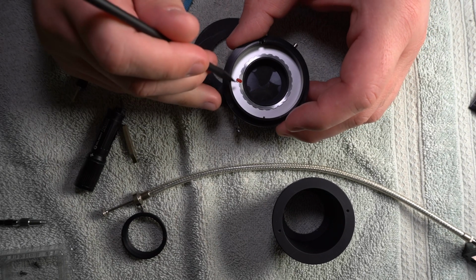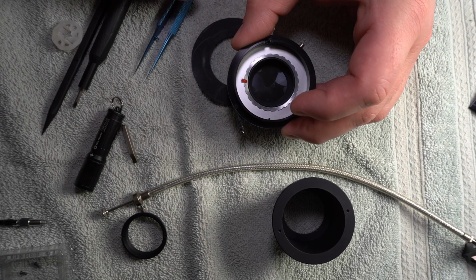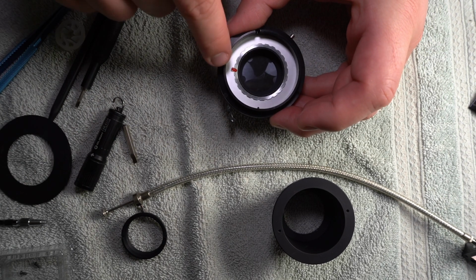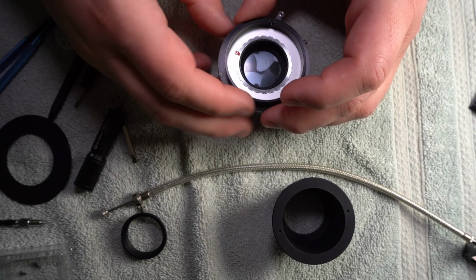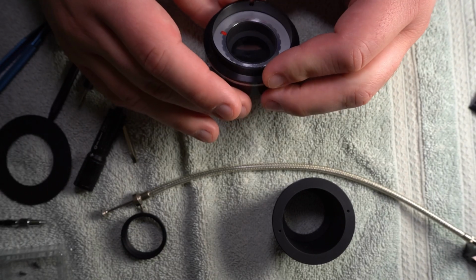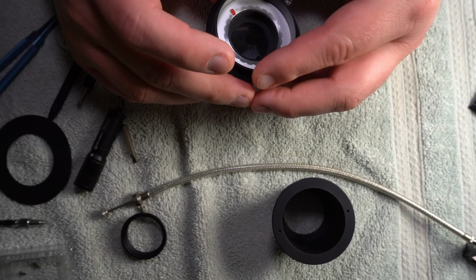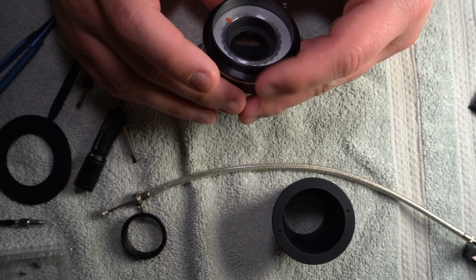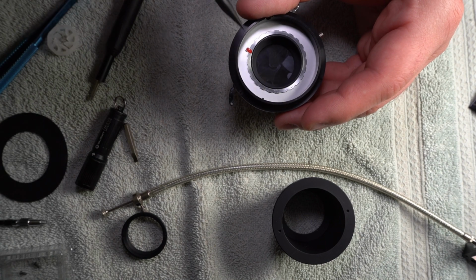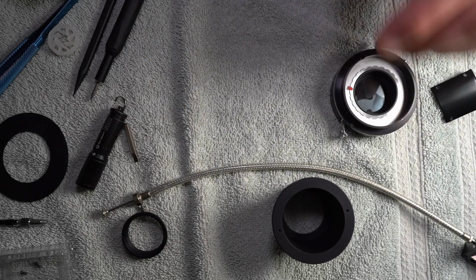Now, that ring can move a little bit and no more. And that screw isn't even really tight, but they keep each other from, I mean, there's no force on this really, on the screw. There is some on the other thing, but, in fact, no, I take that back. That screw and that thing keep that aligned. How does that work? Oh, I know. Okay, never mind. No, why did they do that? I don't know why they didn't tighten that down. You know what? It's marked. They had a reason. Doesn't make any sense to me, but there was a reason for it. I just don't know what it was.